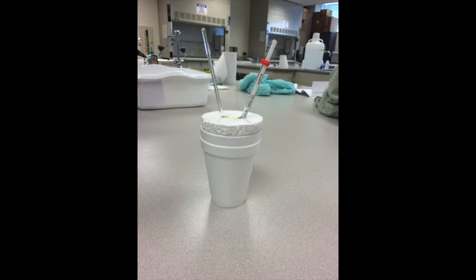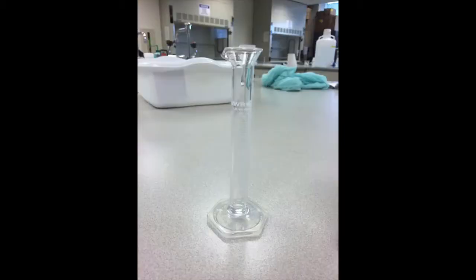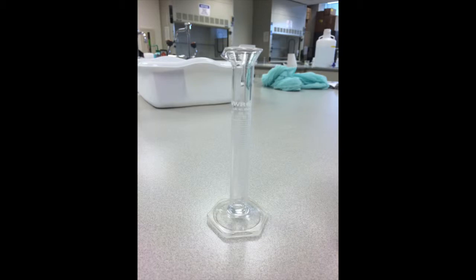The materials needed for this procedure are two styrofoam coffee cups, distilled water, a lid, a thermometer, a stirrer, a reaction mixture, a graduated cylinder, and an electronic temperature probe.